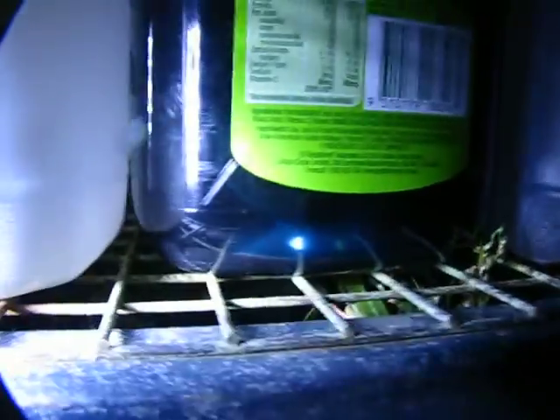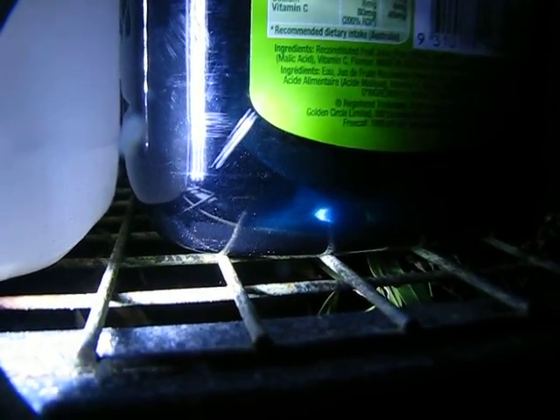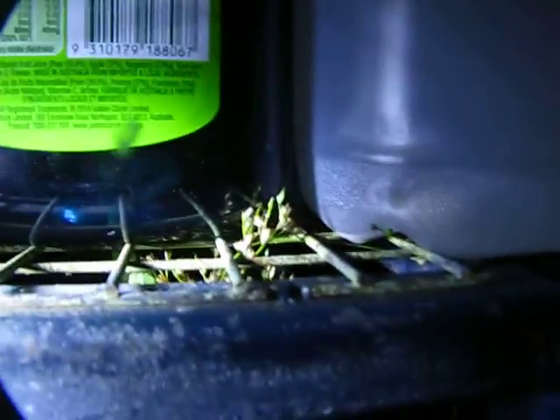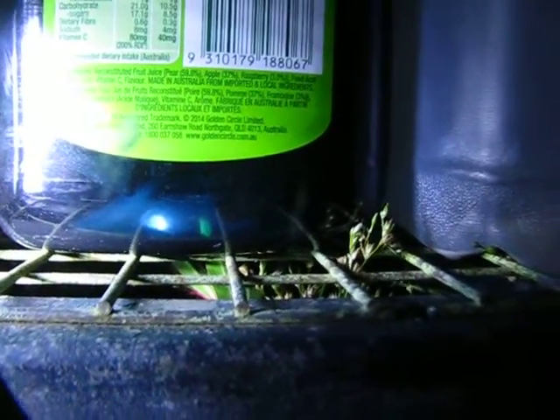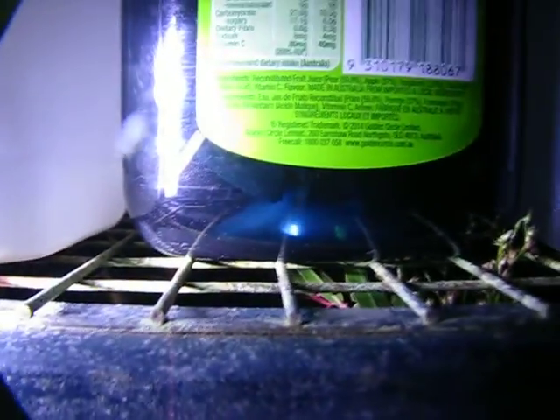Well here's something I didn't expect. Can you see that blue of the copper sulphate there? And can you see that piling up of what looks like powdery charcoal? Now this was all put in with lumps as you can probably see. It seems to be — and if you look closely, which I probably can't do unless I put this on Super Macro — there are little particles continually falling down. Very small amounts, but I picked it up straight away.